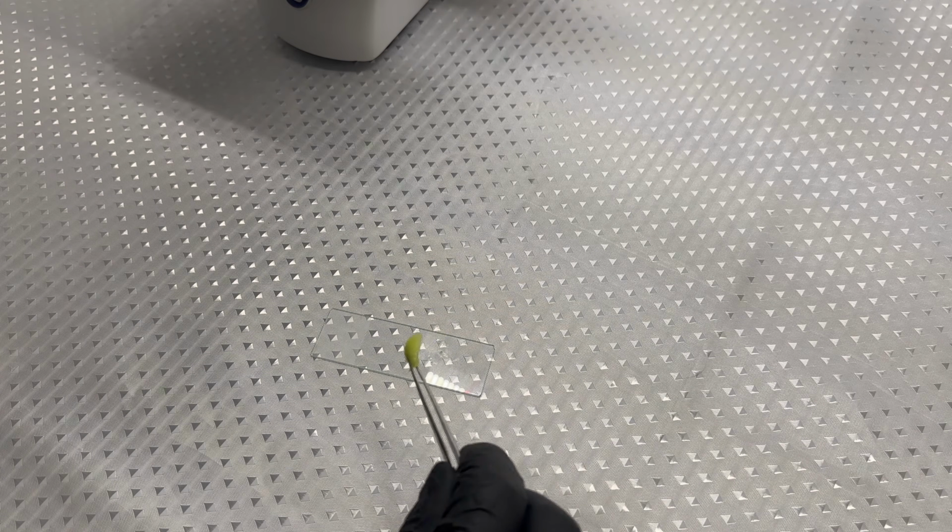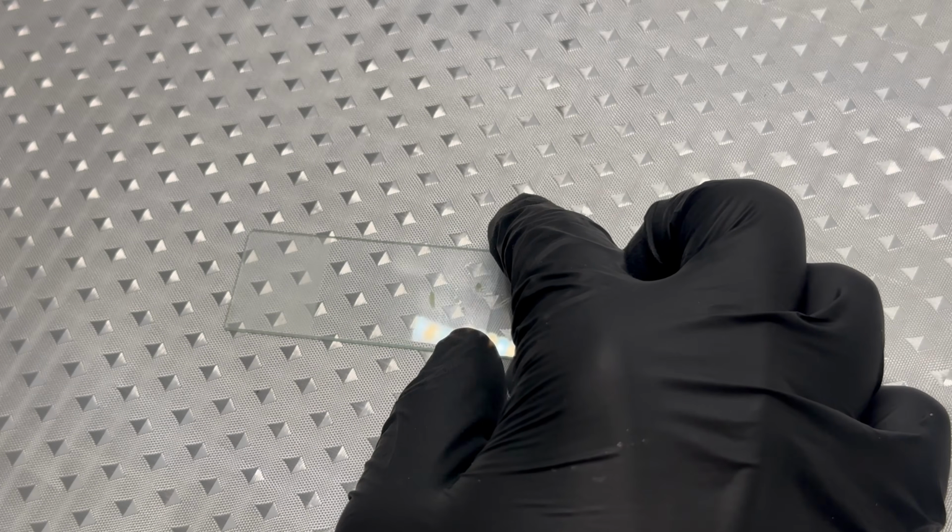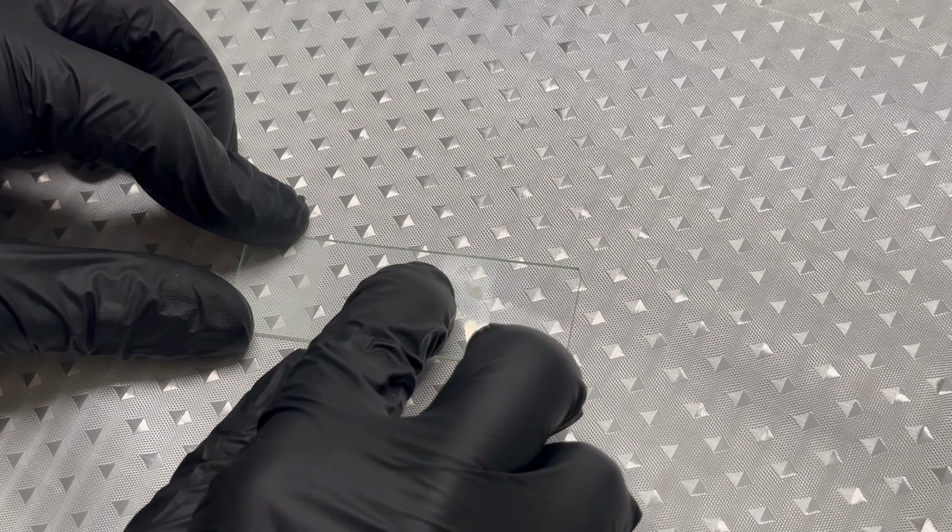Why does it feel creamy rather than juicy? Why does its texture change so quickly when exposed to air? The answers to these questions are hidden deep inside the structure of the fruit.